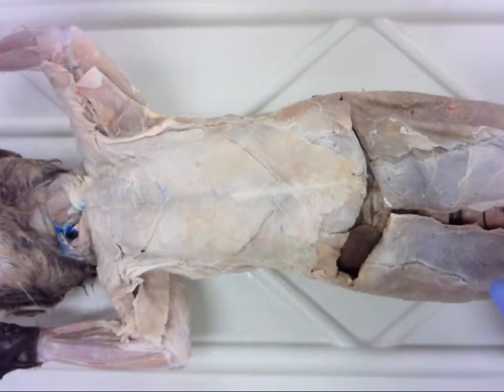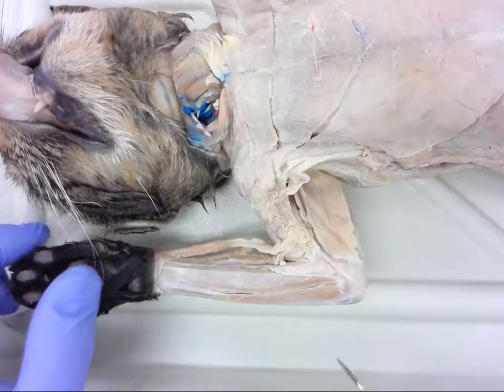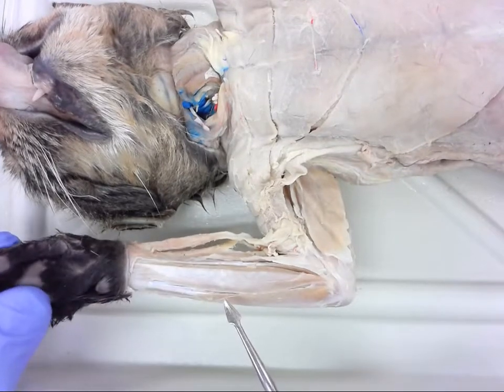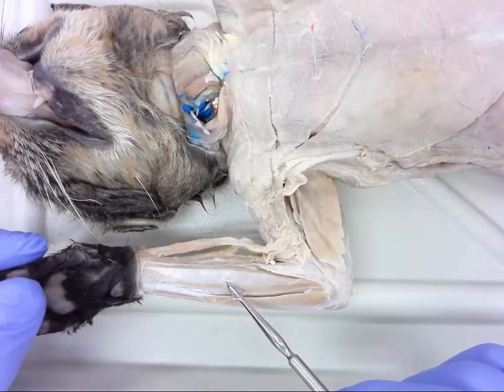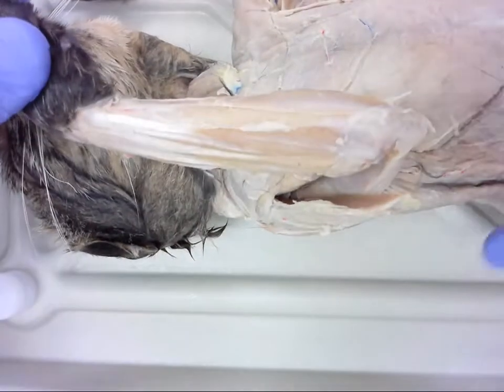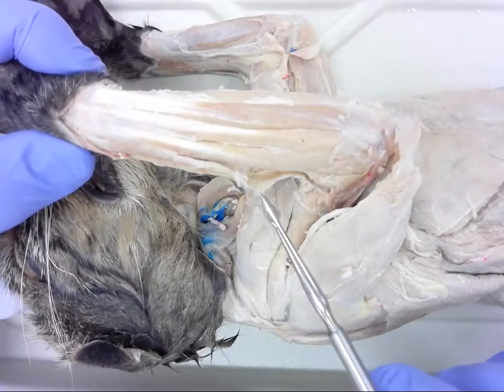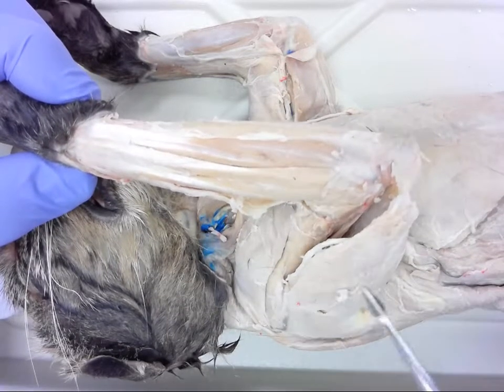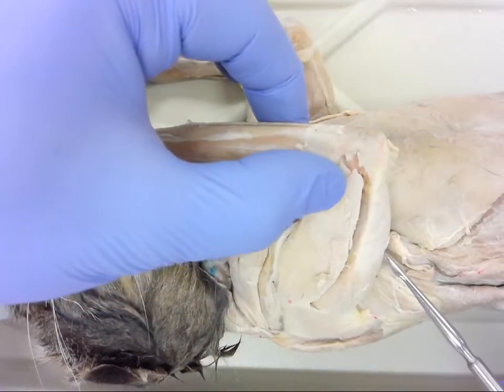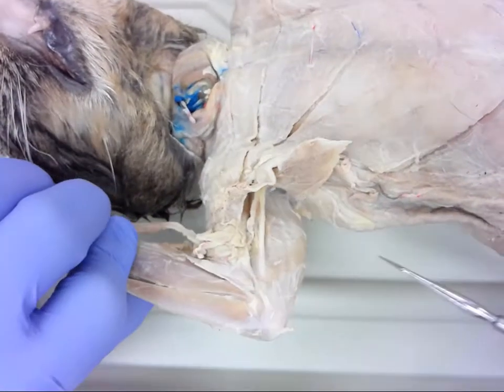Flip back over and zoom in on the forelimb, which hopefully is not an issue for you at this point. If it is, go back and review. Number four is here. Move that around so you can get a good view of all the other structures. Number five — go ahead and roll over; you have a better view of this muscle group. This is number five. Also get a good view of number six here. I'll flip back over to the front to give you another view of number six.